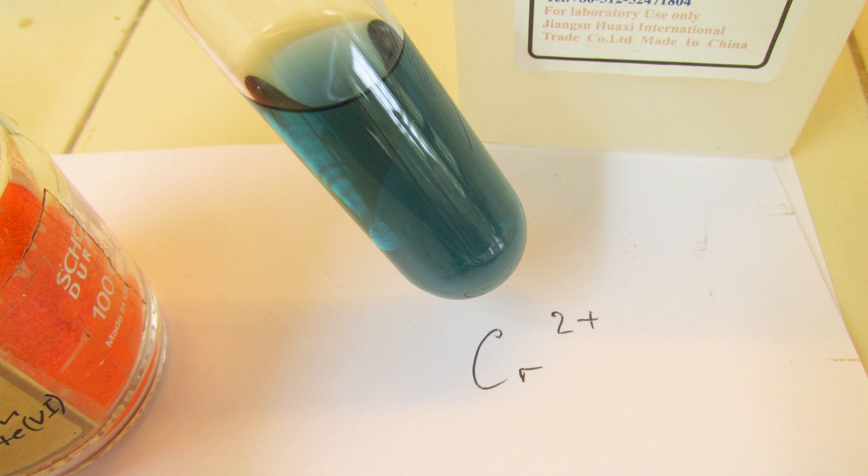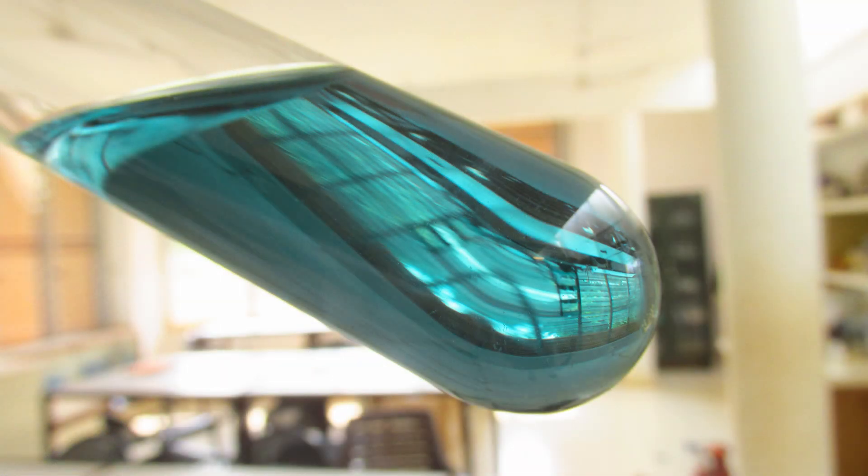This is due to aqueous chromium 2. I think it's unstable, it would be oxidized back into green by oxygen from the air, but look how beautiful it is.